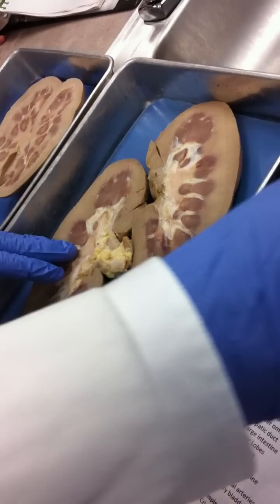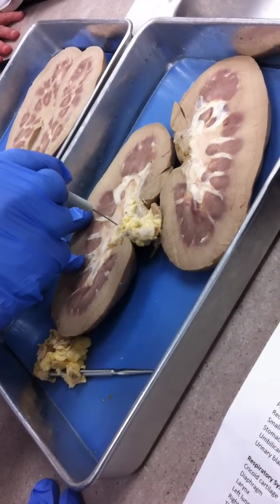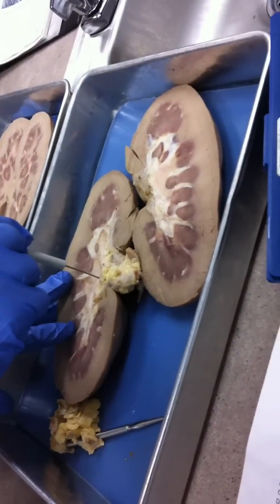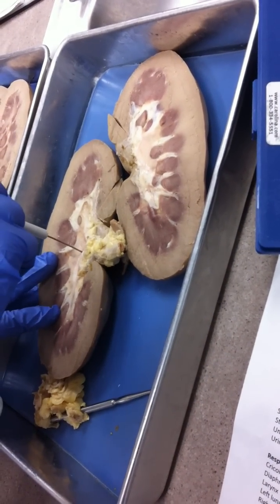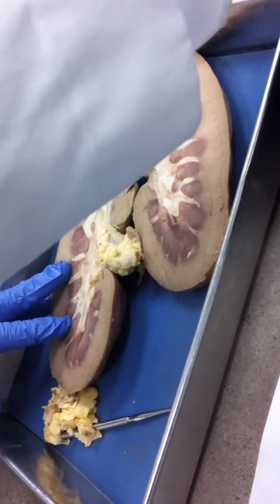The renal pelvis is also an internal structure, more or less at the midpoint. If you can locate the fat in the renal sinus, the pin next to that will be the renal pelvis. I'm going to put a pin right in the adipose tissue — that's the fat. Right next to that will be the renal pelvis. That diagram on your list of structures is the best diagram for studying purposes.